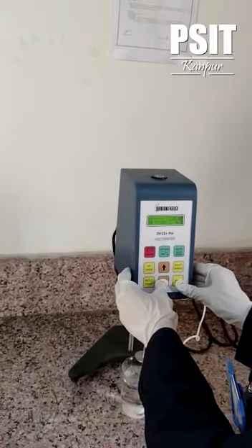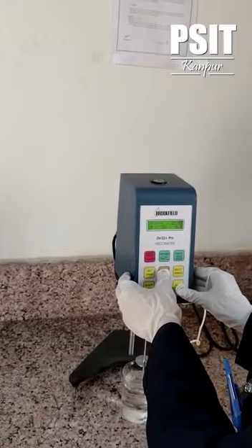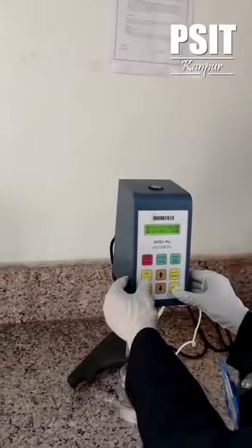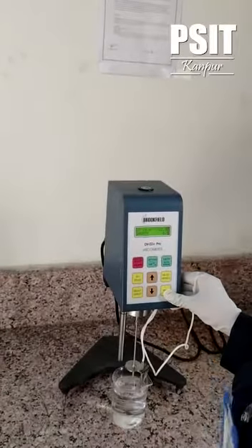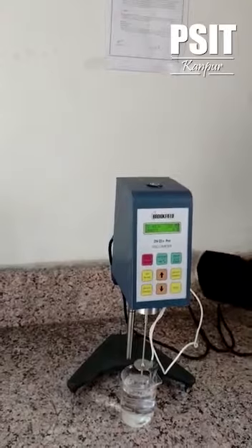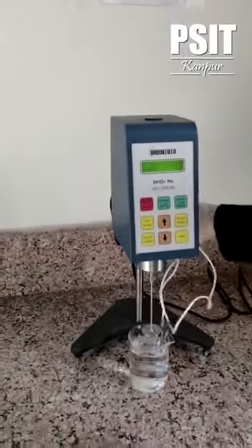You can either decrease the speed or enhance the speed to an extent of 100 rpm. Then after selecting the speed, push the set speed button again. Now the spindle will rotate at a particular speed.